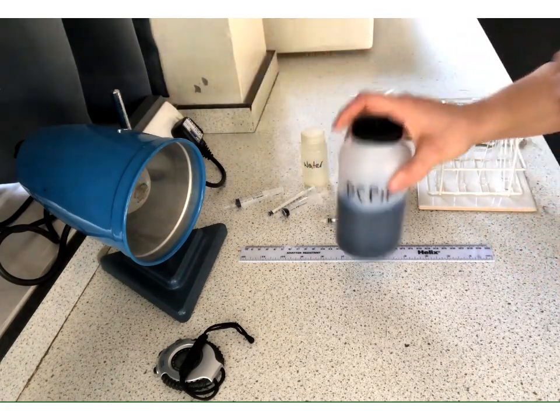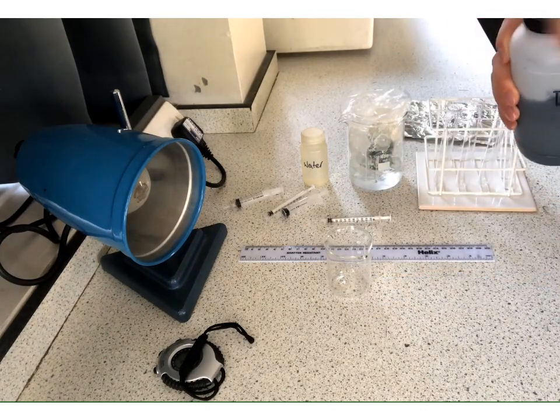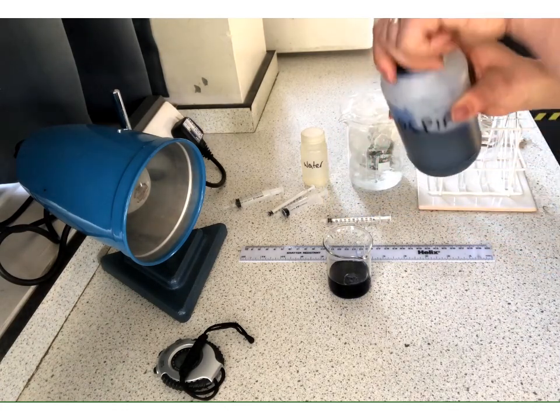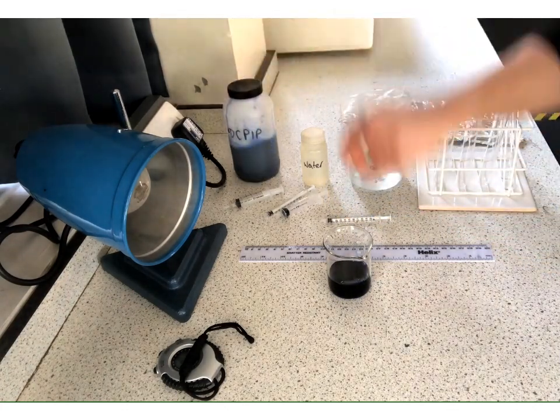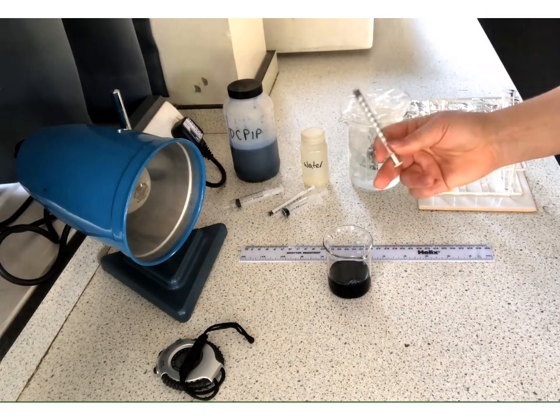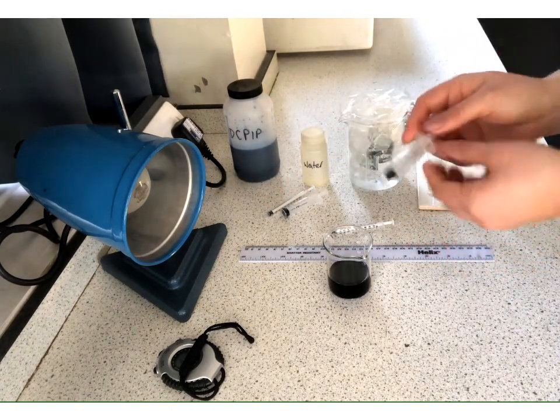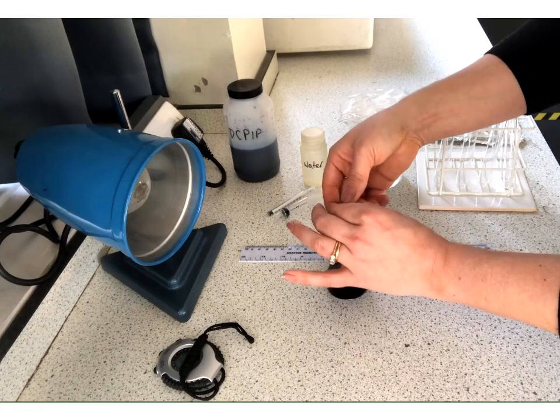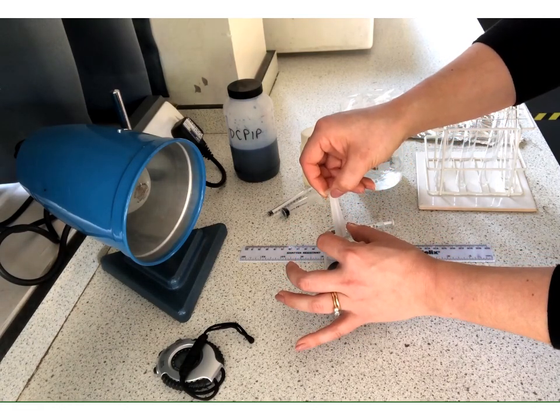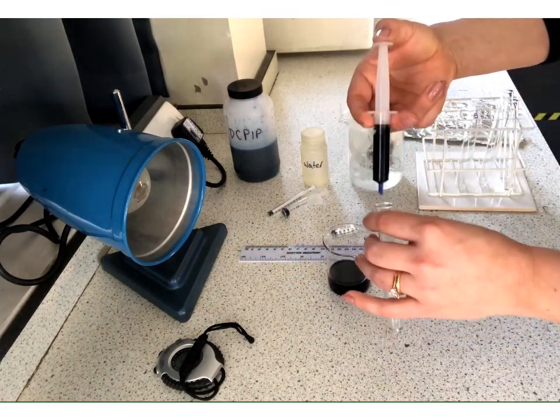So we take our DCPIP. At the moment, we need to decant that into a smaller beaker so that it is easier for us to use. Okay, and then it's 5 centimetres cubed. So as you said, this one only goes up to 1. We'd have to use that 5 times. I mean, we could do, but not brilliant. Whereas this one goes up to 5, so it's more appropriate. So we'll take our 5. Okay. We're adding that to tube A.